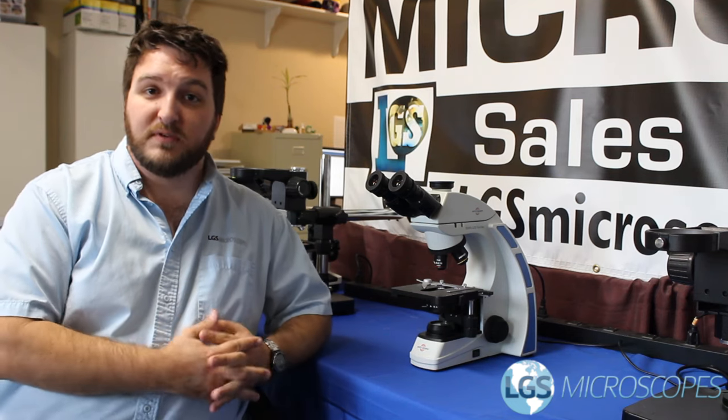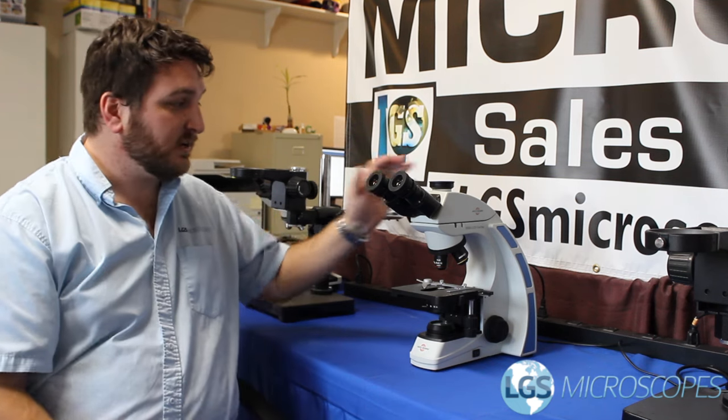This has just been a quick video on how to use the immersion oil on a microscope. If you'd like more information on how to use a clinical microscope from start to finish you can always reference our video on how to use a clinical microscope. I hope this has been really helpful for you.